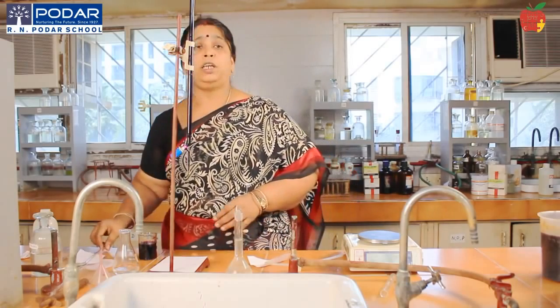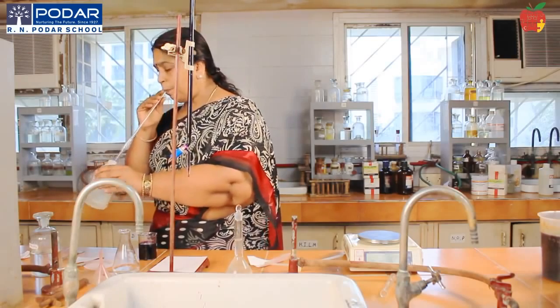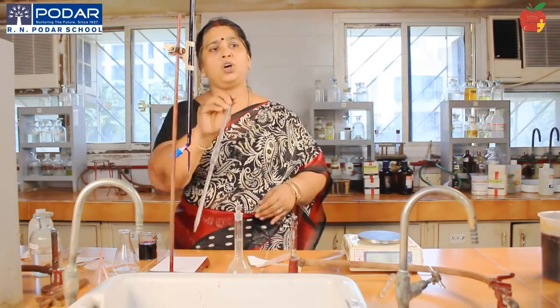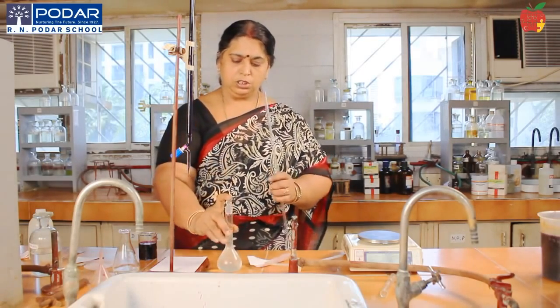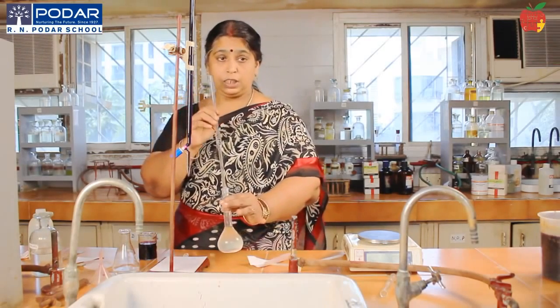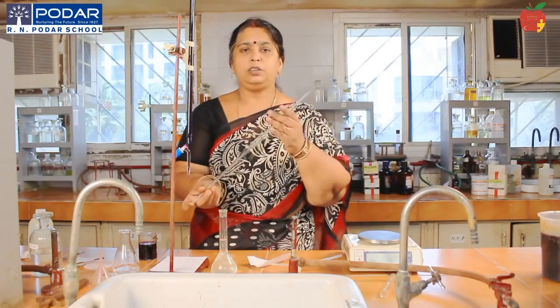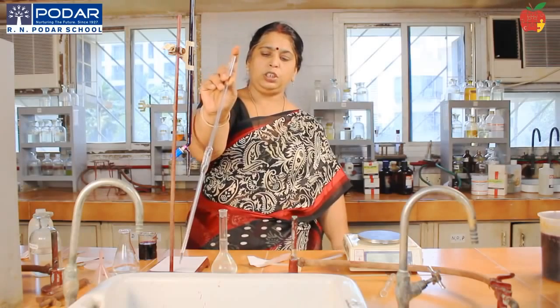Then I have to get ready with my pipette. Now pipette, I should wash the pipette with water. So just tilt it and then throw away the water contents and then rinse your pipette with the respective solution. Now always mix the solution and take it out, then remove it. I am rinsing my pipette now. Just tilt the pipette. See that the pipette is fully wet with the Mohr's salt solution that you have made.